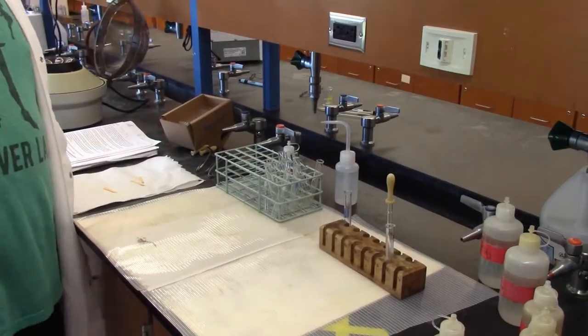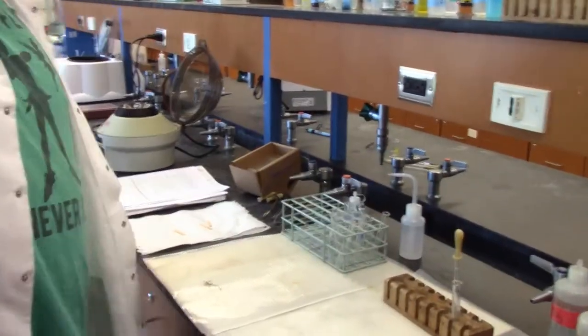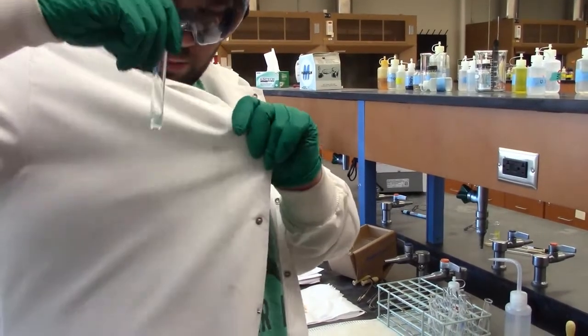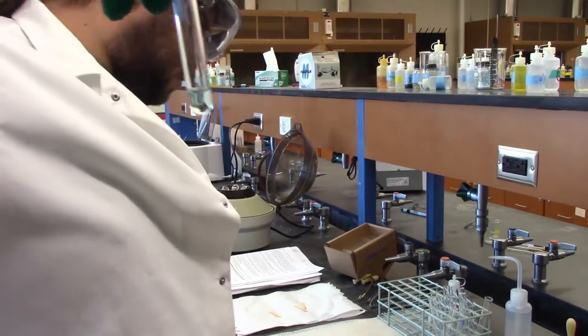All right, hi everybody. Professor French walked through the scheme on the board with you, but now I will be showing you, at least in part, how to do the experiment. Professor French might take over later. We're kind of tag teaming this. But to start with, like we said earlier, here is our pale blue solution of our group 2 unknowns. I'll hold it to my white jacket so you can kind of see the color there. Got a nice pale blue color going for you.